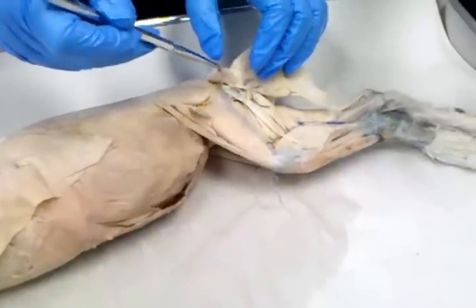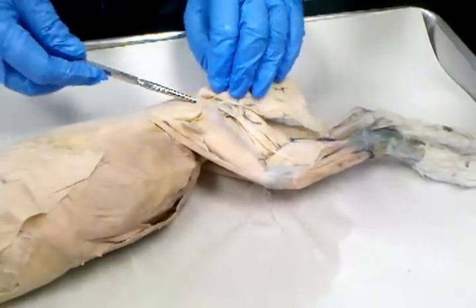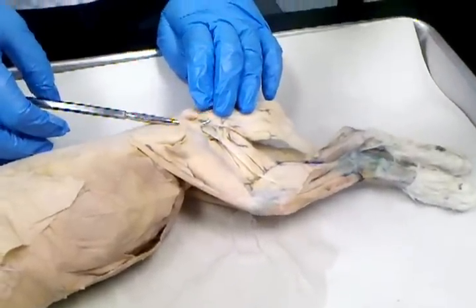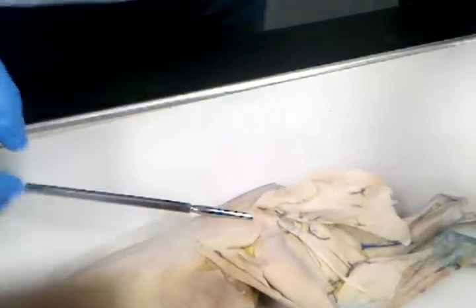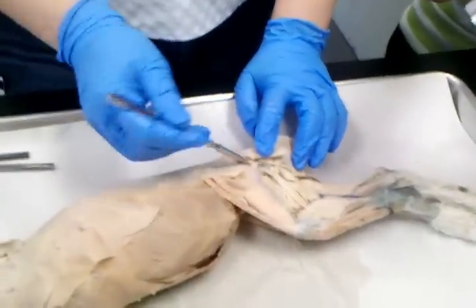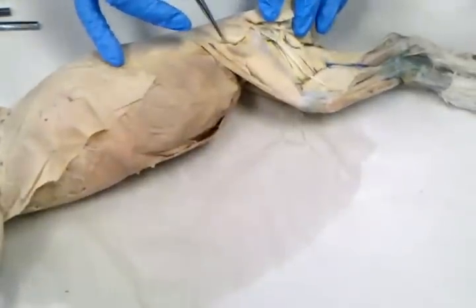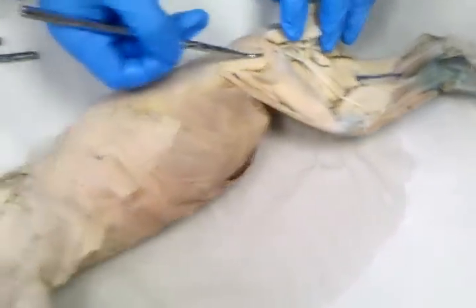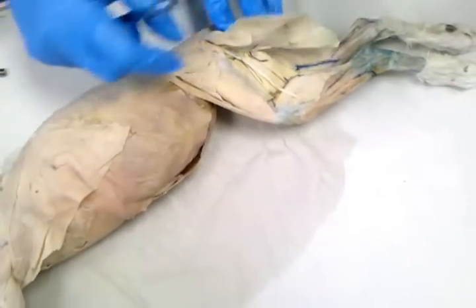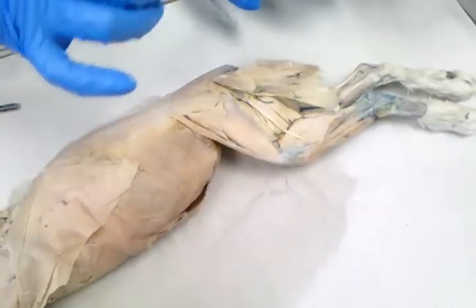Femur. Think about it. And if I flip it out of the way, and I get my probe up under it, this right here is gluteus maximus. It's a little triangular shaped muscle. And on cats, it is smaller than the gluteus medius. It's reversed on humans, okay? So the gluteus medius muscle is this rounded edge muscle right here, okay? So all of that is gluteus medius. You asked which one was bigger? On cats, the gluteus medius is bigger. But on humans, the maximus is bigger.